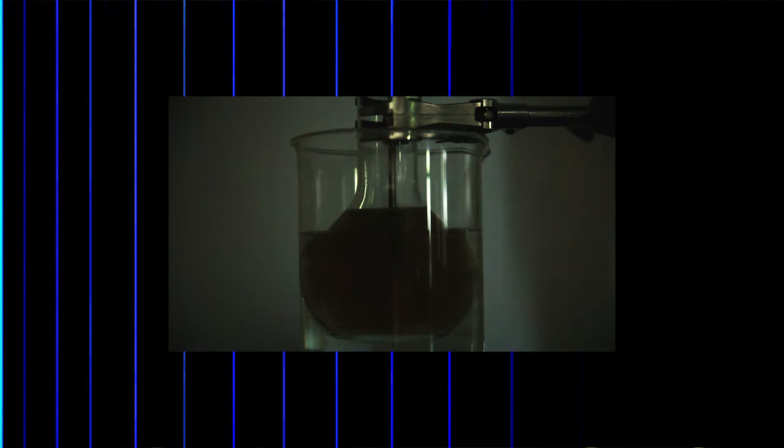You can, however, see the development of the intervals on this RGB plot, where each frame filmed of the reaction mixture was made one pixel wide to show the flashing sequence at the correct scale for the time.